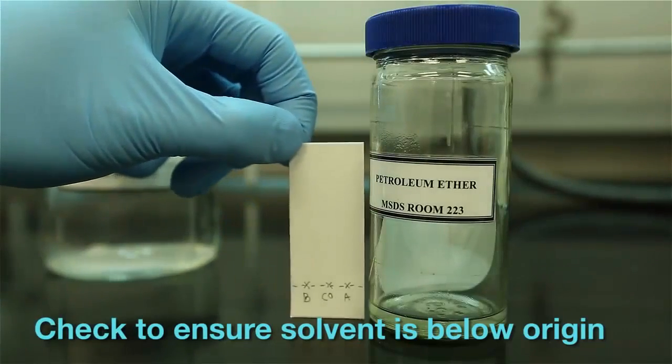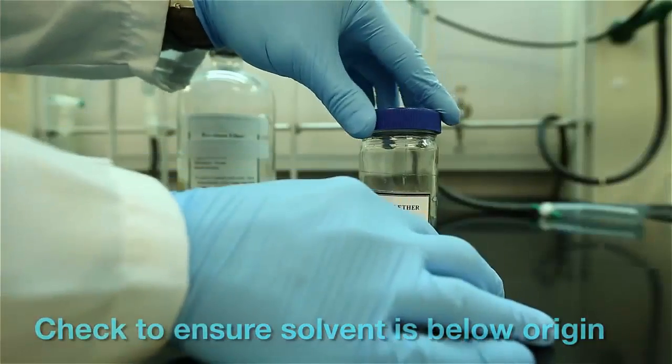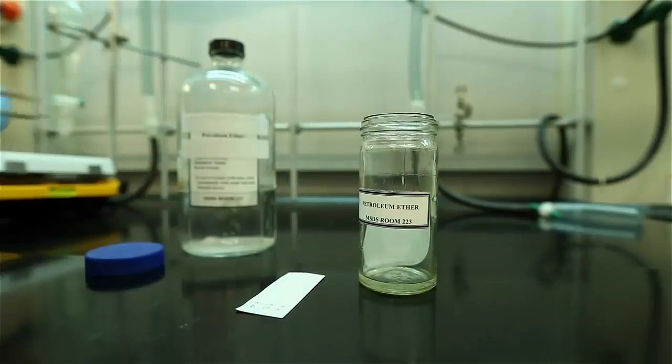When placing the plate into the jar, hold it by the edges and be sure to place it upright and leveled without touching the filter paper.